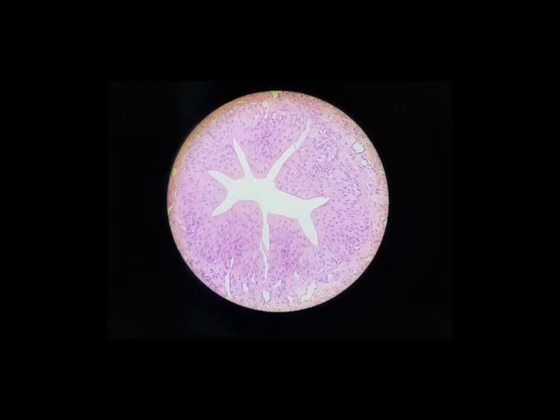And while it is not good to learn, I guess cheat isn't the best word to use here, but a kind of cheat that you can use for the transitional epithelium is it's always going to have some kind of big hollow space in the middle. Now, some other tissues might have that also, but when you see this big kind of spiky hollow area and you're kind of stuck and you don't know for sure which tissue you're looking at, and you know you're going to have to guess, that's a good guess. It's transitional epithelium, because this area is what will need to stretch as it fills with urine.